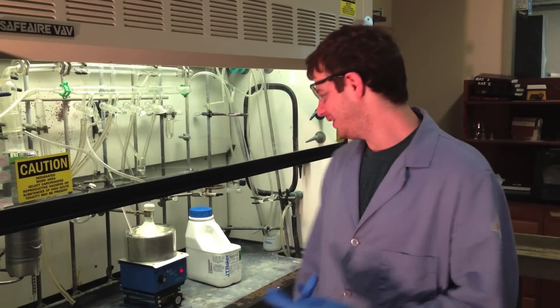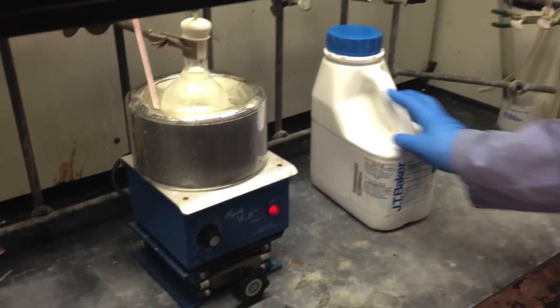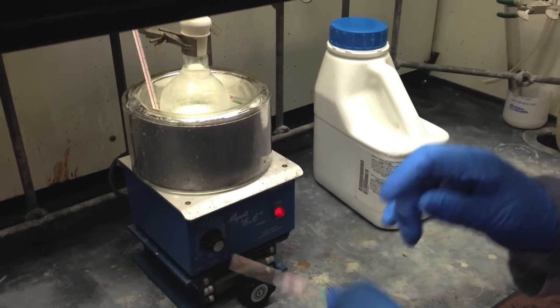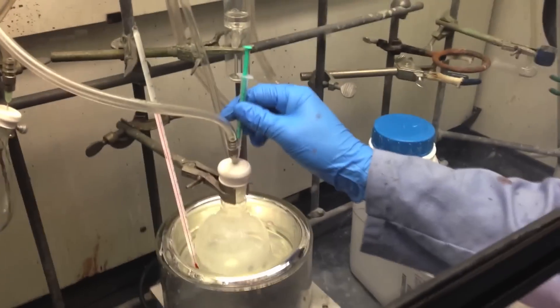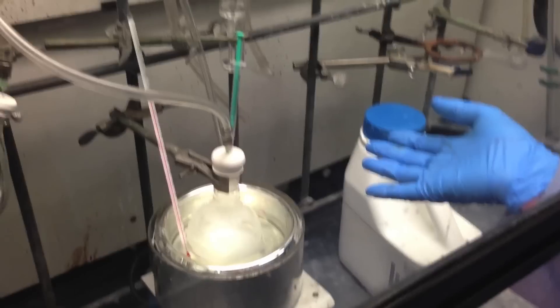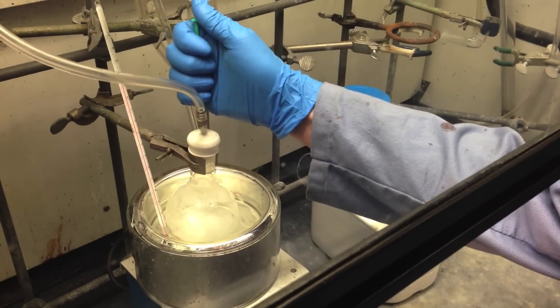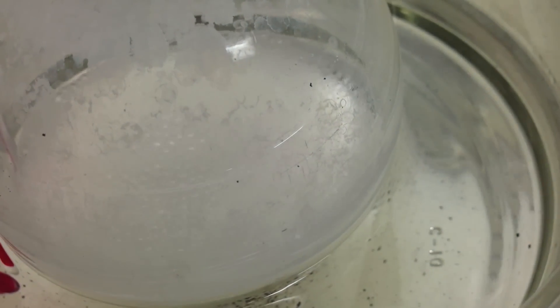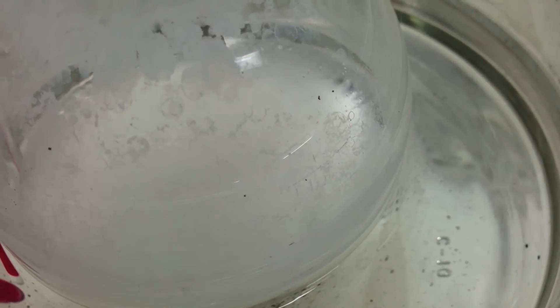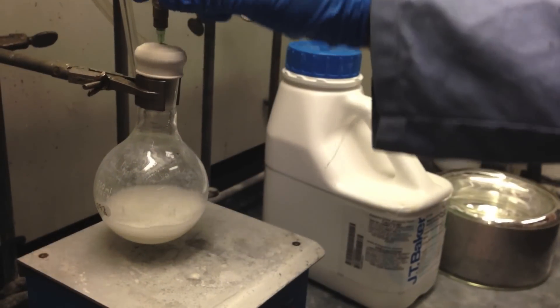So we're back 24 hours later. I've removed the syringe pump and the reaction is complete — it's been about 20 hours. We're going to inject a small quantity of water. Remember, the alkyl-lithium reagent reacts violently with water, so I've chilled down the reaction a bit and we're going to add the water to destroy the remaining lithium reagent. I'll add this slowly — and if you look closely you can see fizzling. Now it's had a chance to react with the alkyl-lithium reagent, so I'll go ahead and take off the cap.